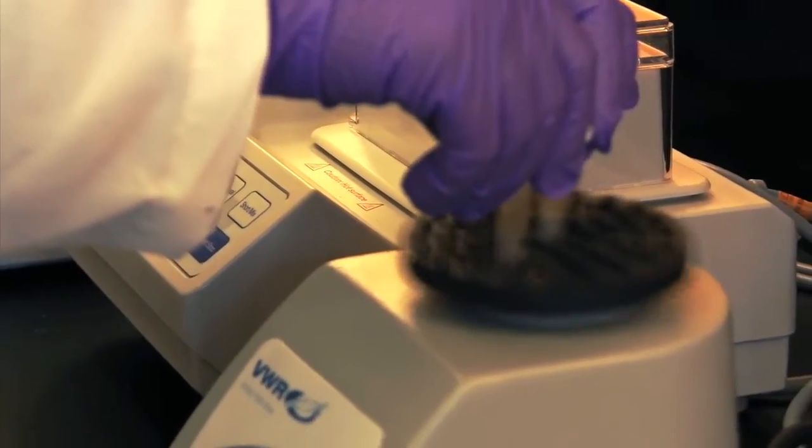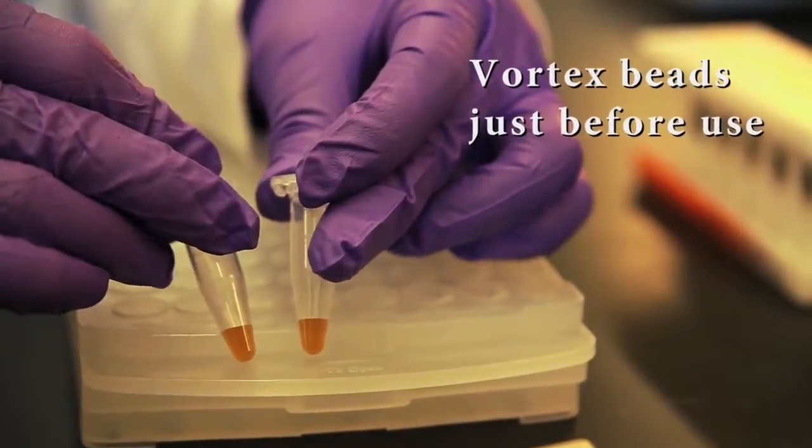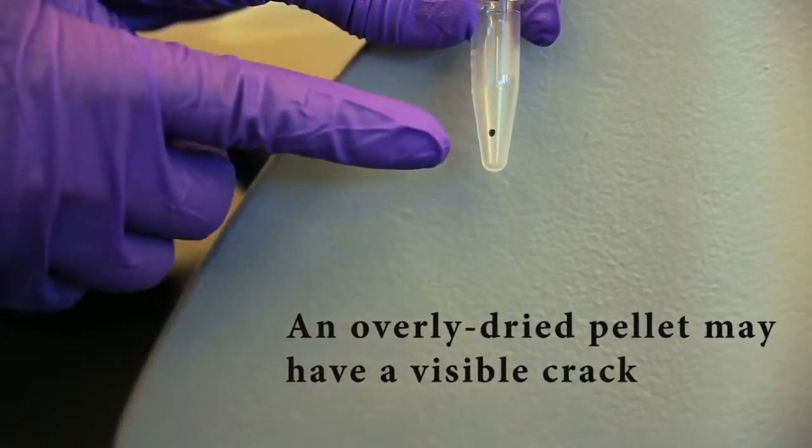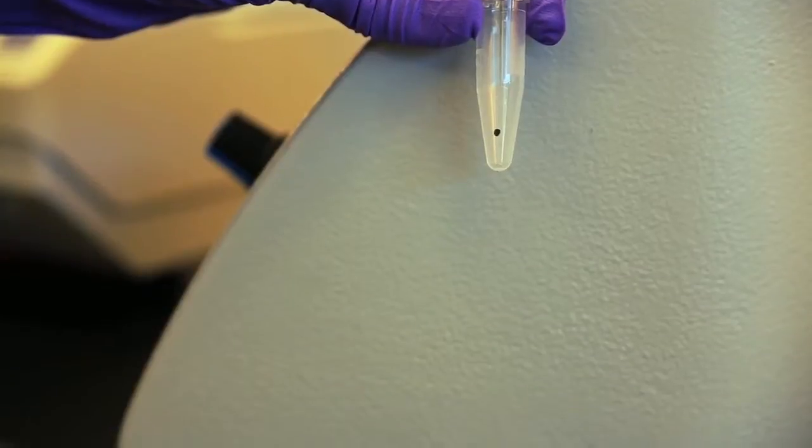Beads tend to settle out quickly. Be sure to vortex the beads just before use. They should be a uniform suspension. Do not over-dry the beads. This can make resuspension difficult and reduce yield.